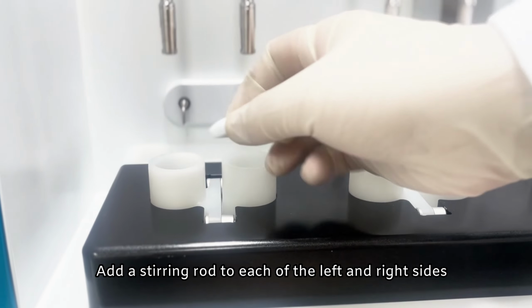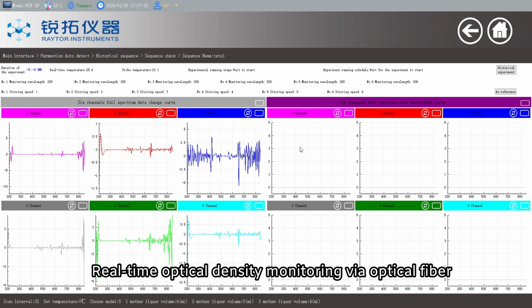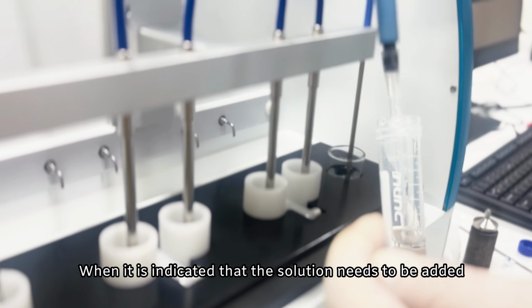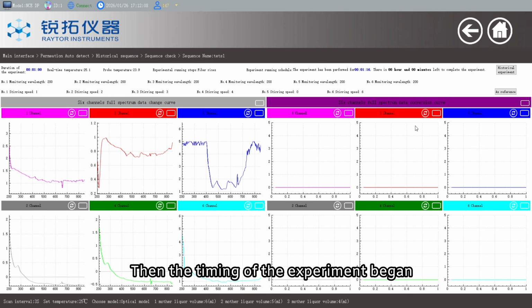Add a stirring rod to each of the left and right sides. After clicking the run sequence, real-time optical density monitoring via optical fiber. When it is indicated that the solution needs to be added, add the sample to the left side of the device as the donor side. Then the timing of the experiment began.